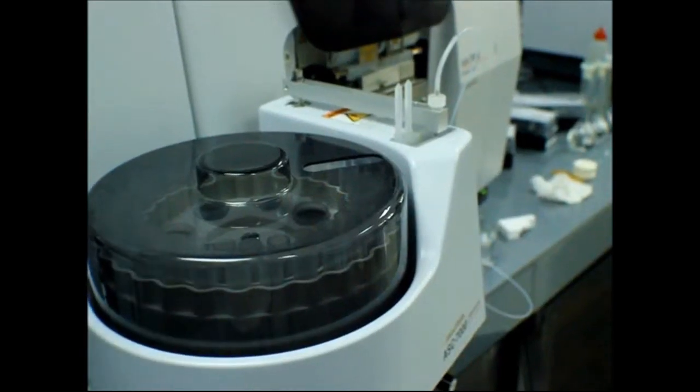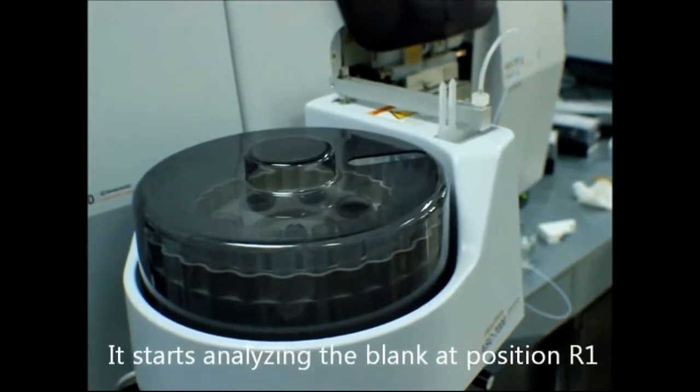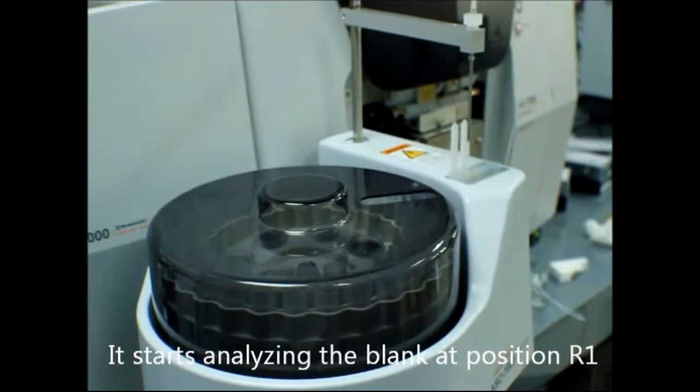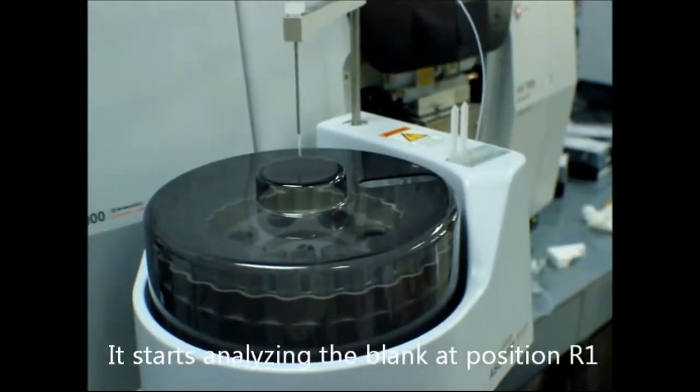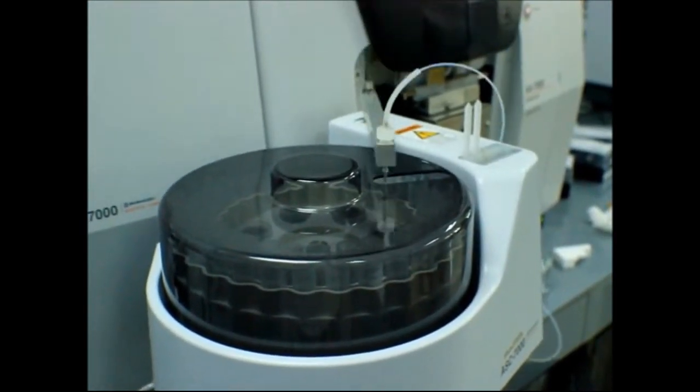So you can see, filling the rinse spot with water. They are filling water. Actually, you don't need to do anything. You just sit down and watch. Filling. Then they will come to R1, R1 to do a blank check. Okay, this is your blank.